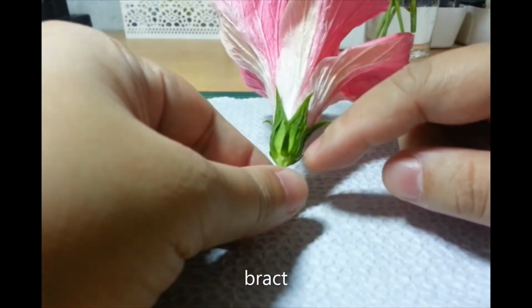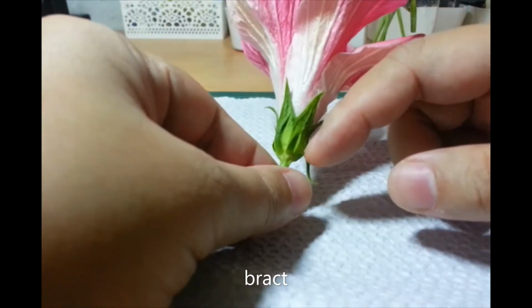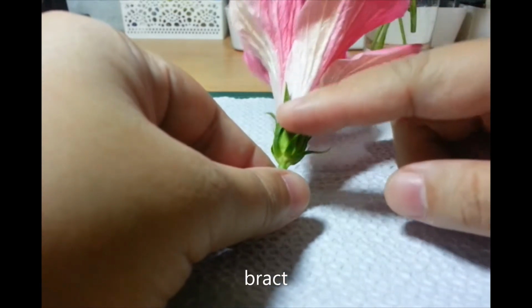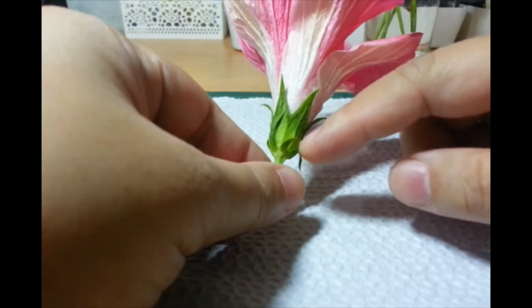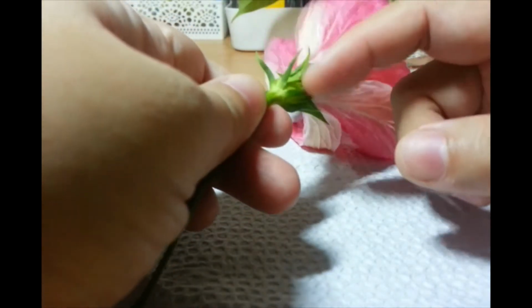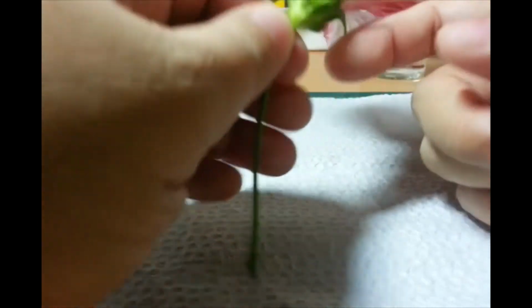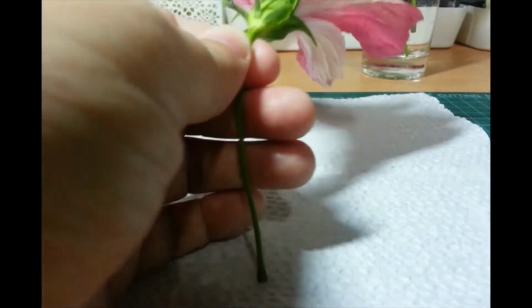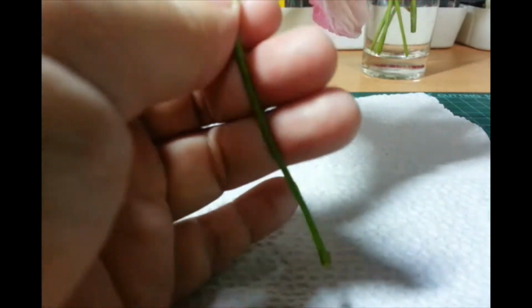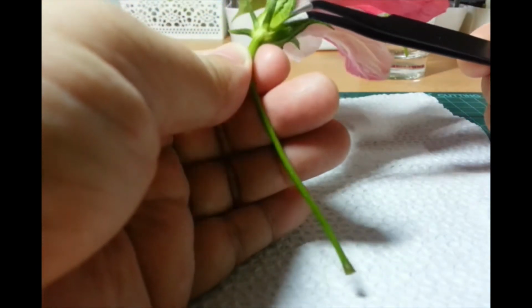I'll include that in the notes, or if I have time later, I'll put labels on the video. So, these are bracts, these smaller leaf-like structures. As you can see, they're also arranged like a ring. So, this is a bract.